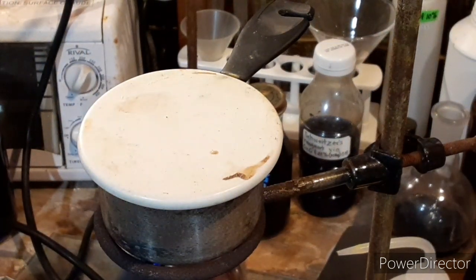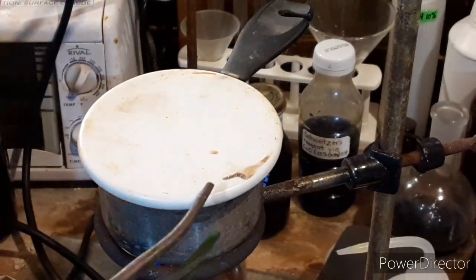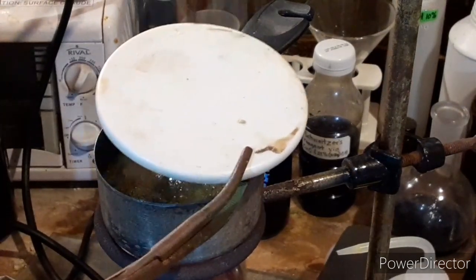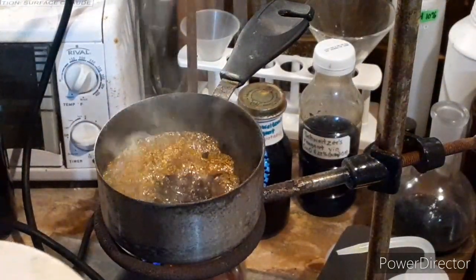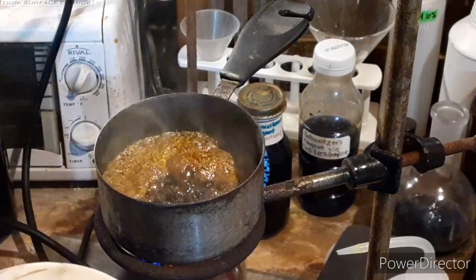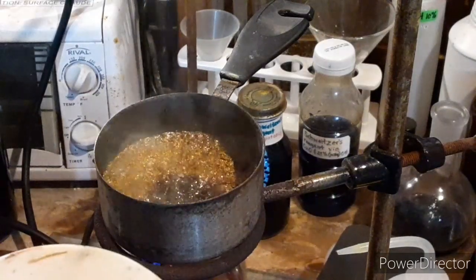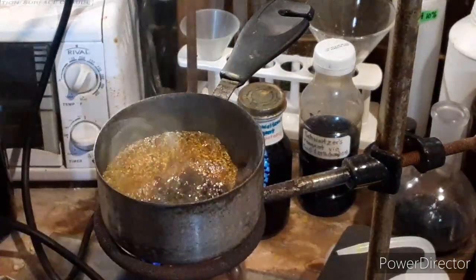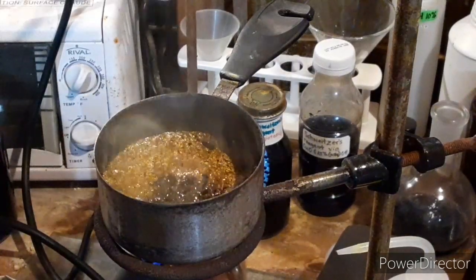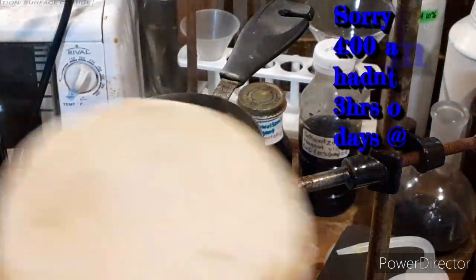As promised, I am trying my ghetto torch burner setup to make potassium thiocyanate. In one of my stainless cup crucibles, I've mixed as homogenous a mixture as I could: 23 grams of anhydrous potassium ferrocyanide, 16 grams of sulfur flowers, and 8 grams of potassium carbonate. I'm going to put the lid back on.